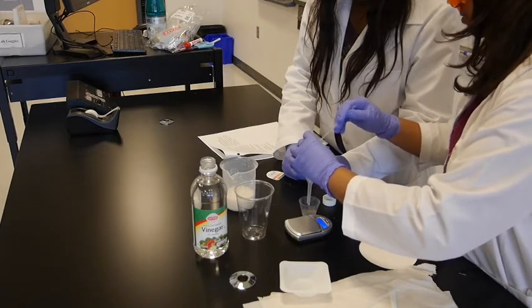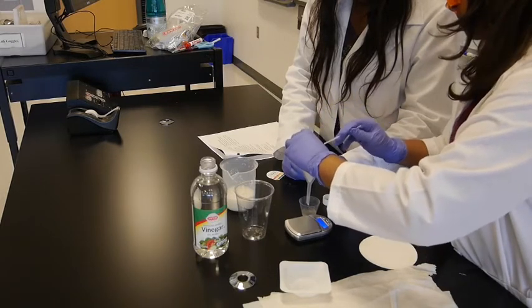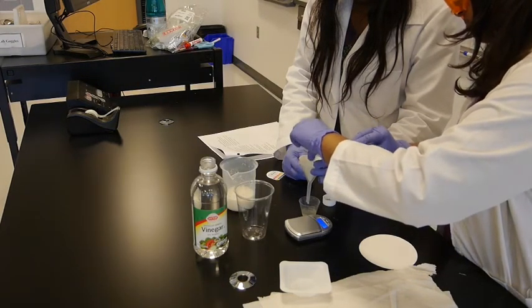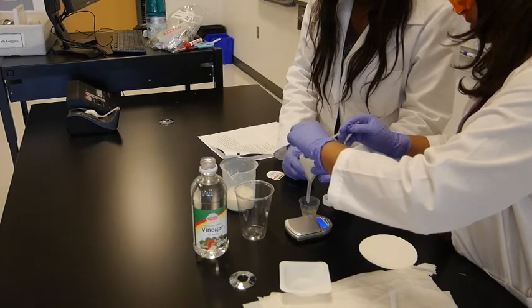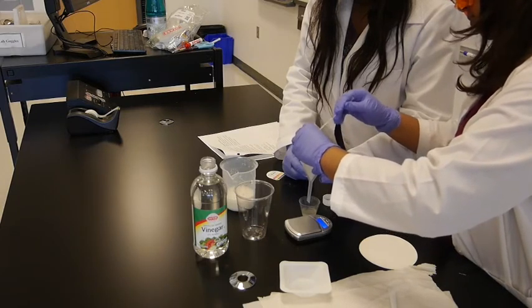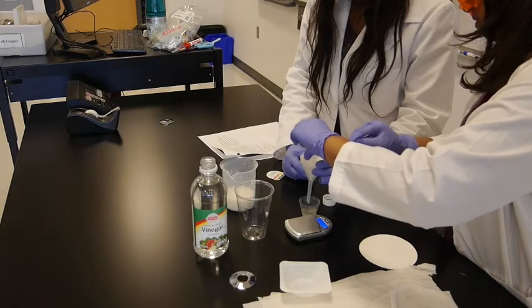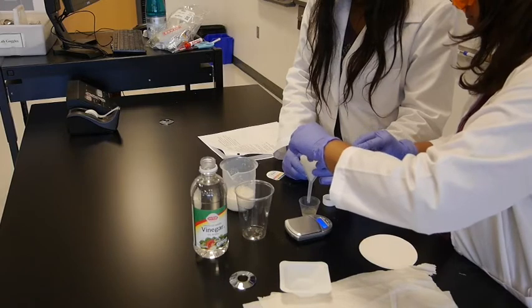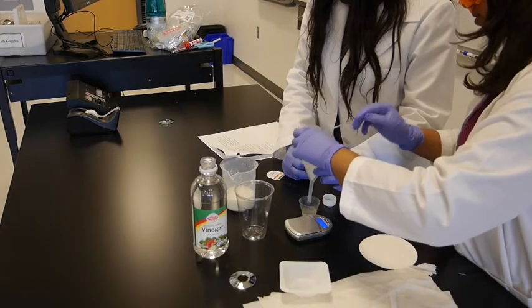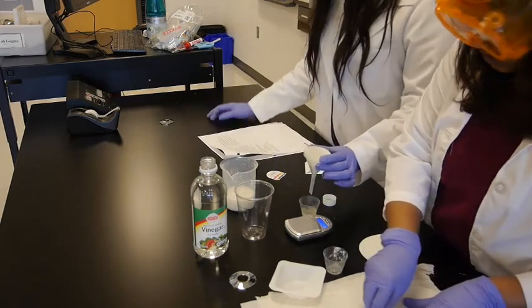The lab is quite simple. I'm trying to take all of it. Can we wash this? This will leave protein. We can wash this with water, right? Yes, if you need, you can wash this with water and make sure to take all of the solid part. Take it like that. There you go. We took as much as possible. You can use water too.